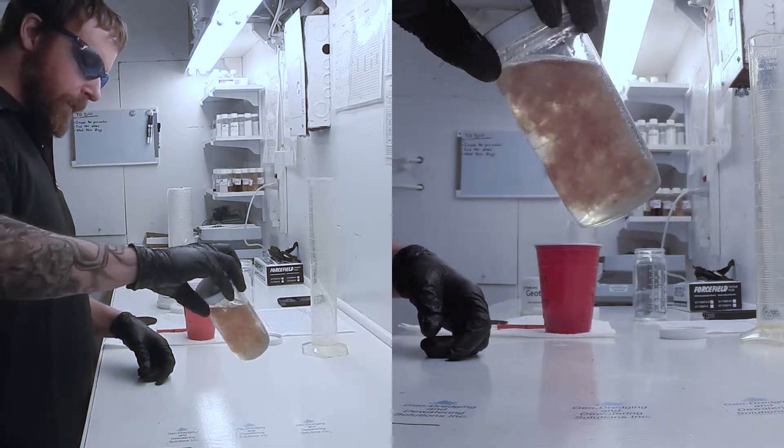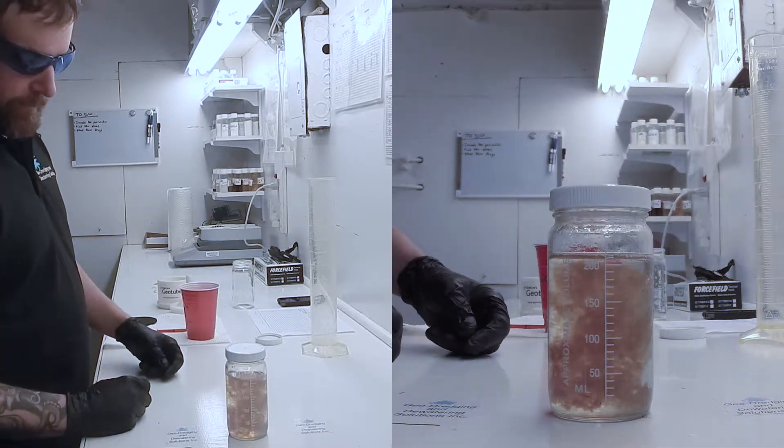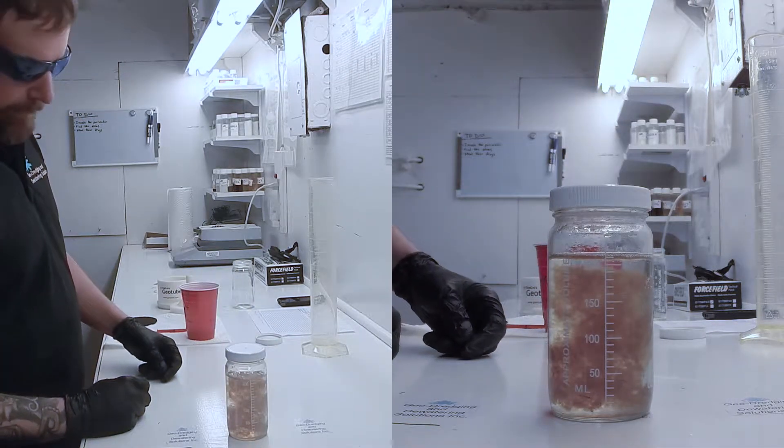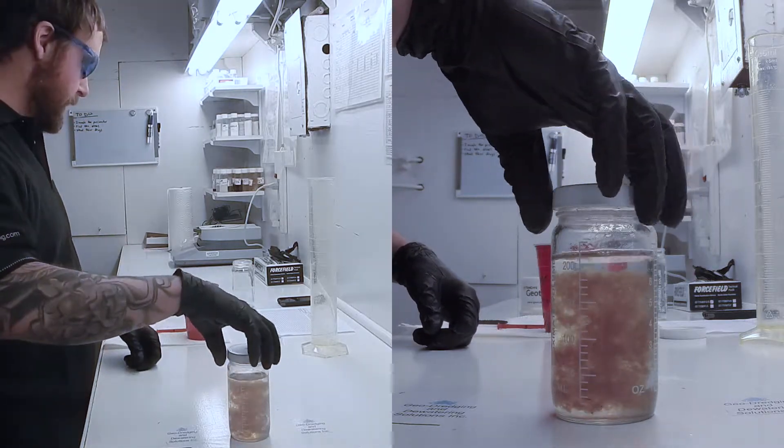All right. There we have it. This is what the material looks like when it's flocculated. Next step is to actually perform the RDT.